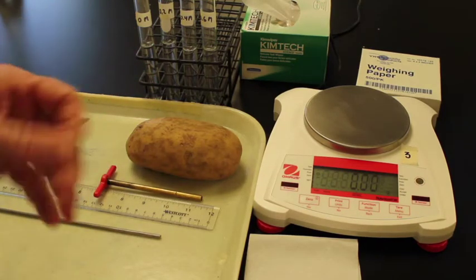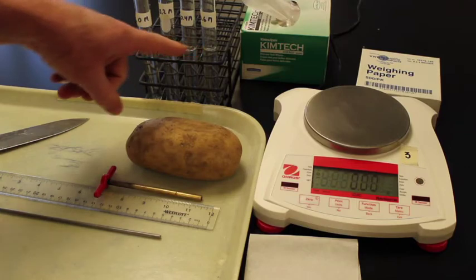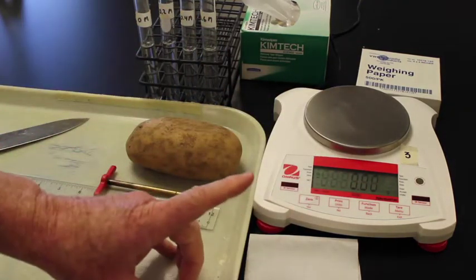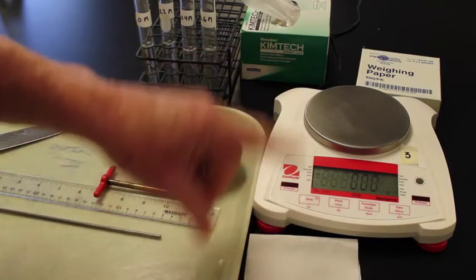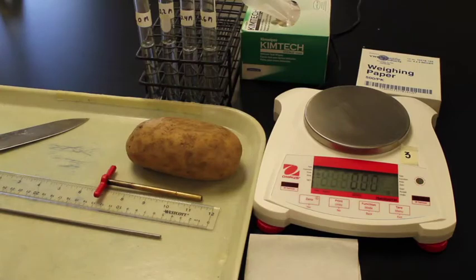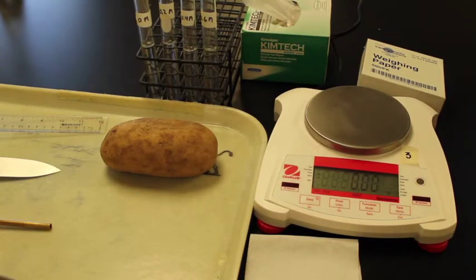Another variable that you may not think about is that when you take a potato out of each of these solutions, it has water on the outside. The water may hang differently. If one drop of water drops off on one, that could amount to quite a bit of a difference mass-wise. So we need to make sure that we blot each potato. We're going to take the potatoes out and blot them fully on Kim wipes, one round of blotting. We're going to mass them before, and we'll blot them after to make sure that the water hanging there is the same. Now that we have all of our methods planned out, we're going to run the actual experiment.